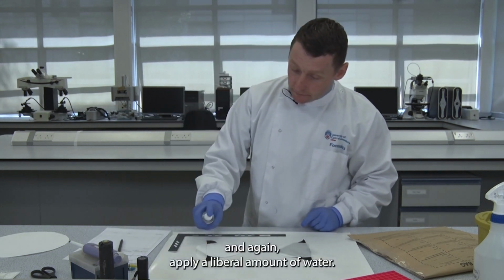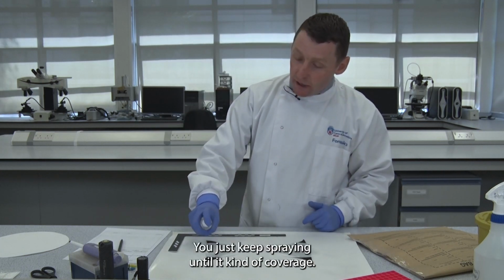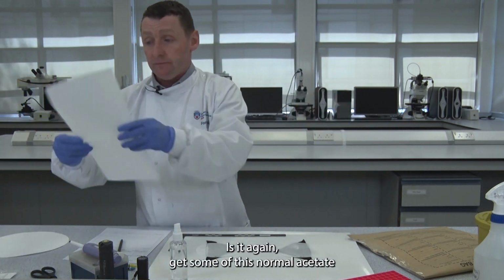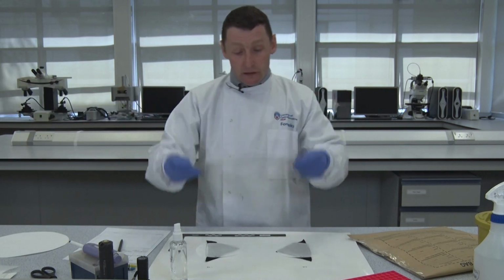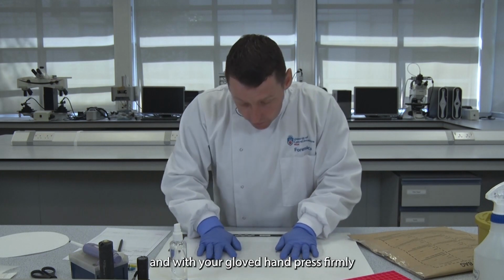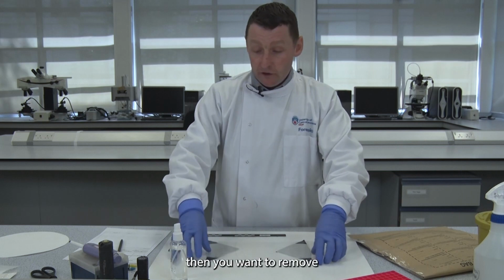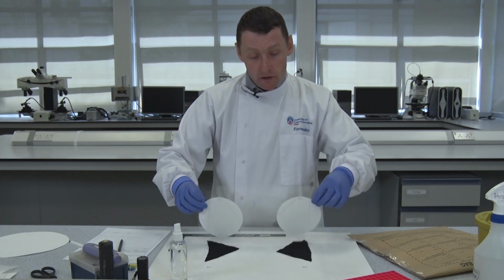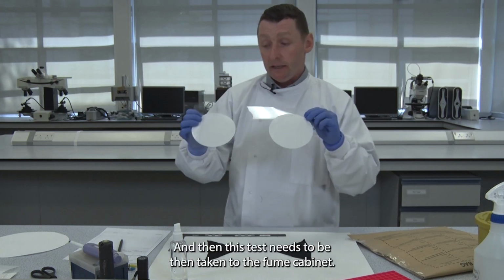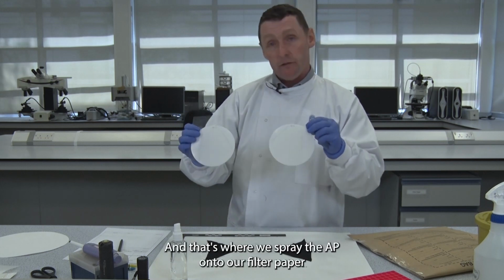And again, apply a liberal amount of water. There's no set volume, you just keep spraying until it covers. Again, place some normal filter paper on top, and with your gloved hand, press firmly for about 4 to 5 seconds. Then you remove the filter paper from the fabric, and this test needs to be taken to the fume cabinet, and that's where we spray the AP onto our filter paper.